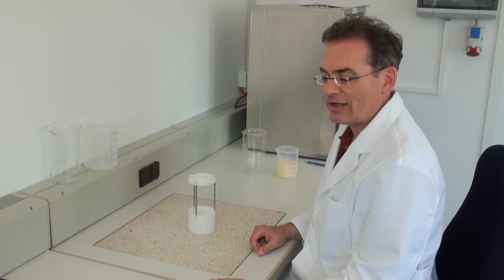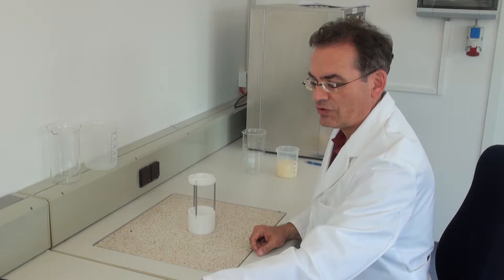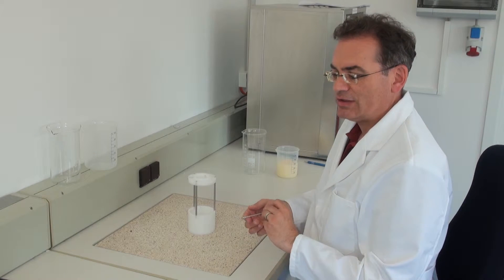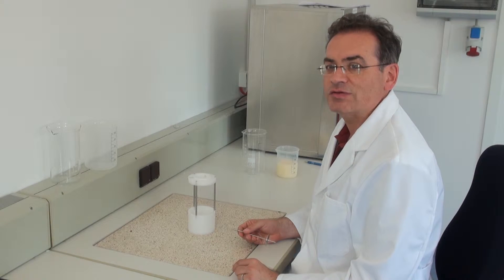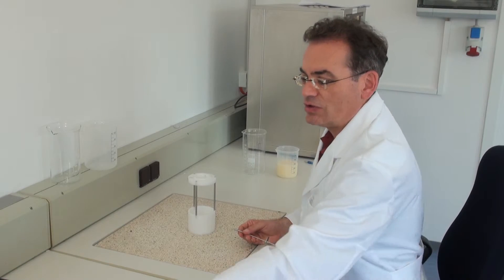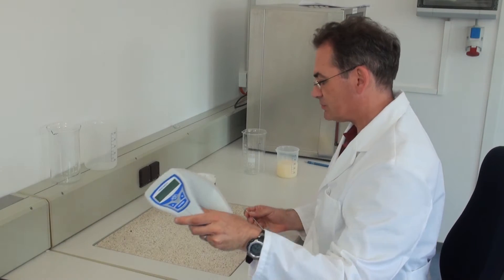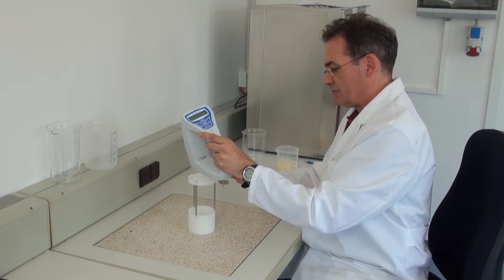Depending on what viscosity I choose a corresponding rotation body. I would like to show you now how to attach these to the viscosity meter. For this I take the viscosity meter and put it under this mount.